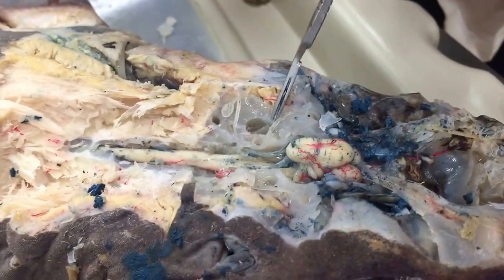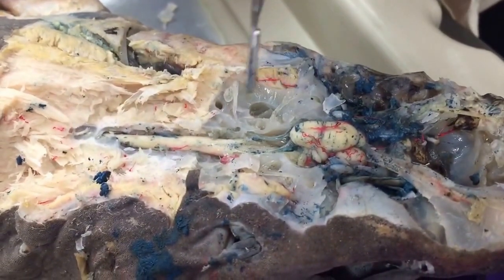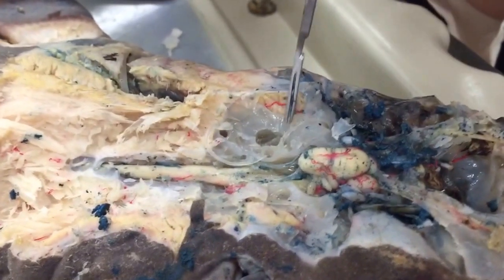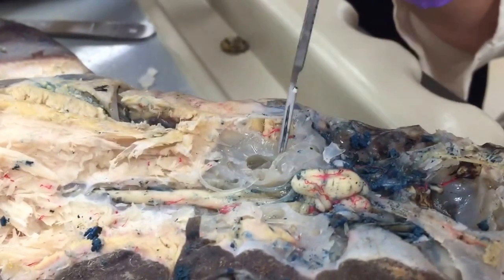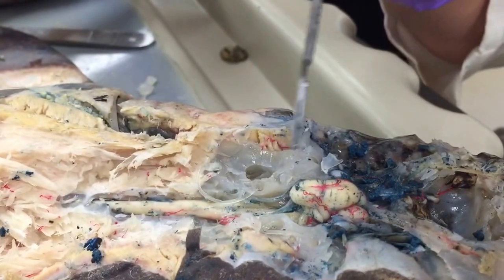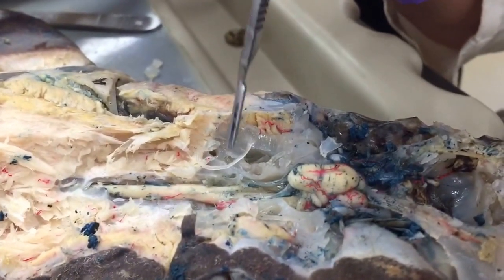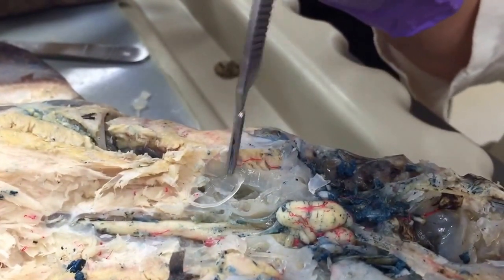And then kind of completing the almost circular, triangular surrounding of the sacculus would be the left lateral semicircular canal, which we can't really see, but the position would be here. Okay, so left anterior semicircular canal, left posterior semicircular canal here, this guy, which would sit in this groove, and then left lateral semicircular canal.